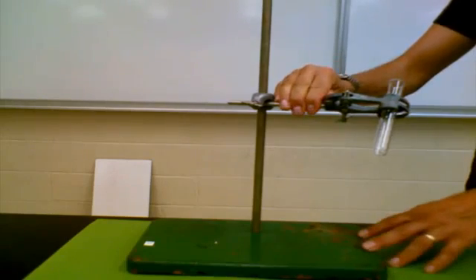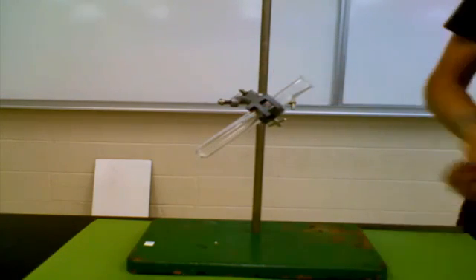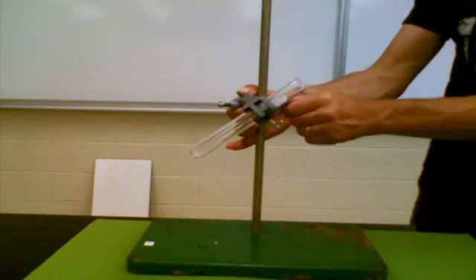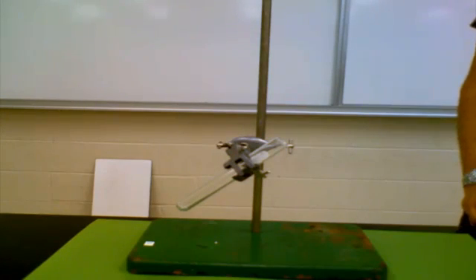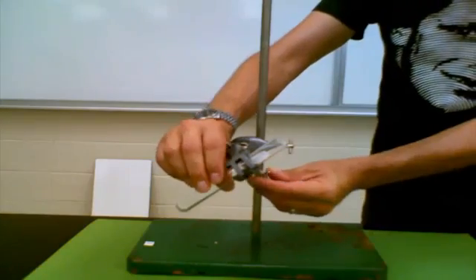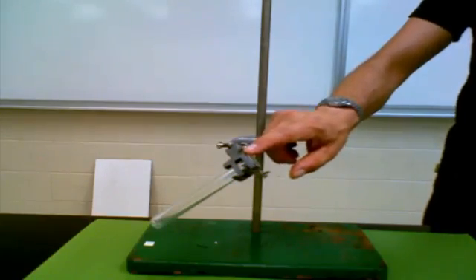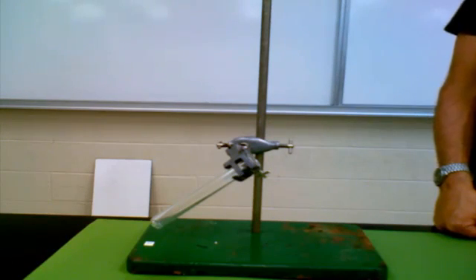Now, many of you are going to want to put the test tube in the clamp in the middle. You want to avoid doing that because you don't know what's going to happen to the test tube when you're heating something up. So the safest thing to do is to slide that test tube down so that the lip is sitting right on the edge of the clamp. That is the proper way to put a test tube into a clamp on the retort stand.